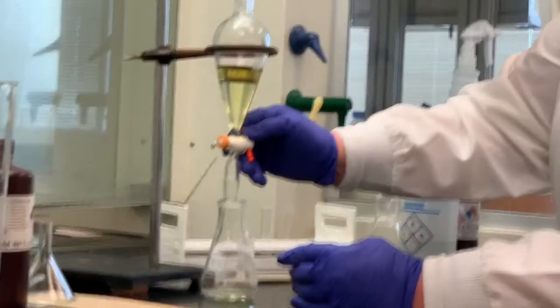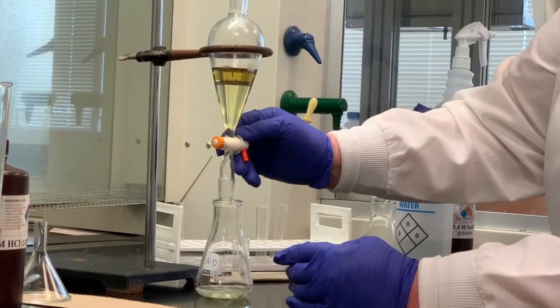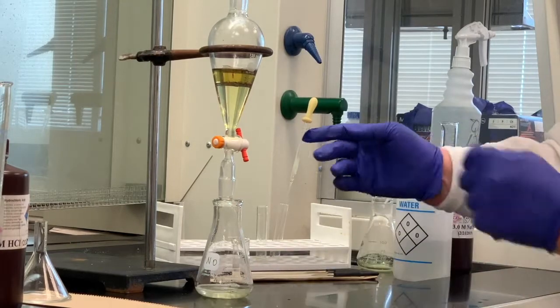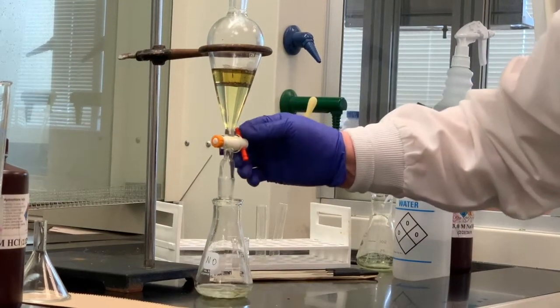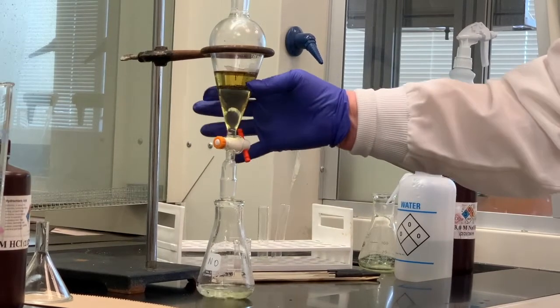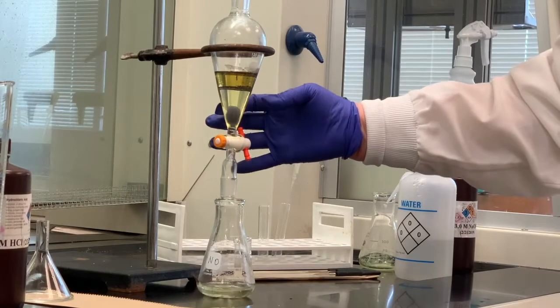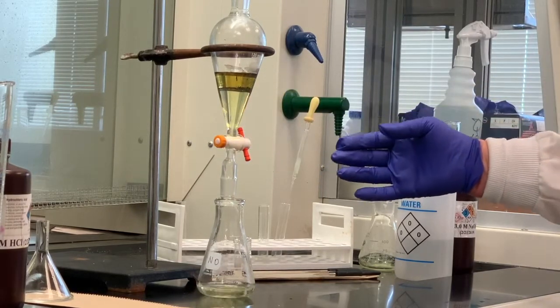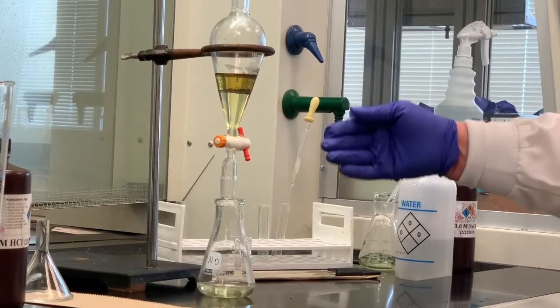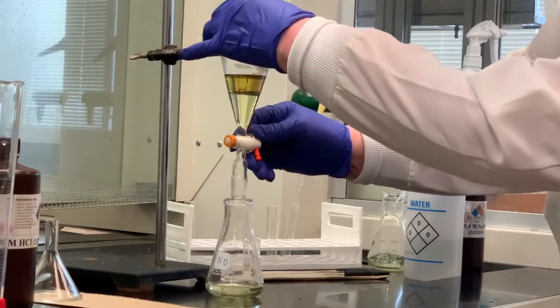I'm going a little bit slower, though you could go a little bit faster. I'm just keeping my eye on this kind of black mucus layer here. That isn't uncommon in some cases. Sometimes you will form a type of emulsion in between the two different layers. Sometimes what we'll do is add sodium chloride to that. I don't really see the need of doing that now, since we are going to precipitate these later.